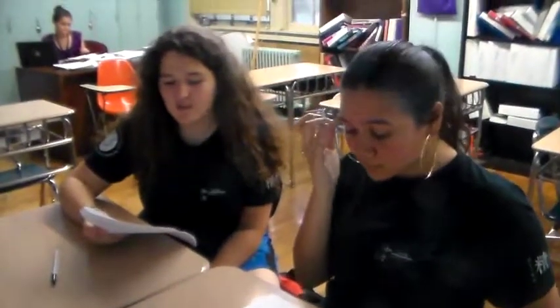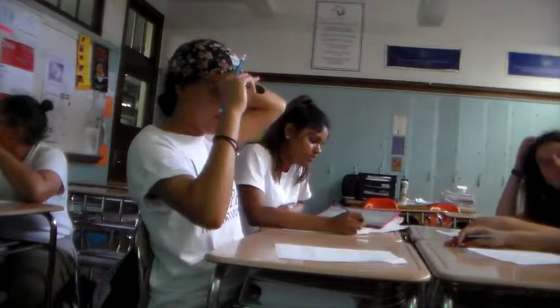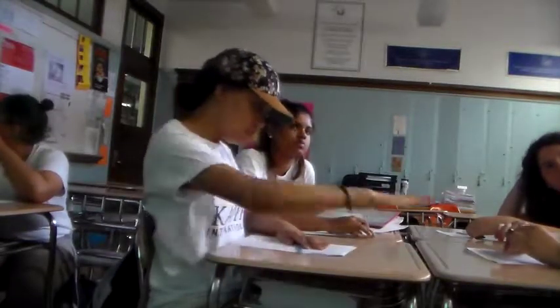If we have equal amounts of acid and base, then the solution will be neutralized because the base and acid H ions cancel out. We say that if acids and bases have the same concentration, then they will neutralize each other because of their opposite charges. You have your testable question, you have your hypothesis, and they're both good. Now I'm going to tell you what materials you're going to be using today, and then after knowing that, you're going to refine your hypothesis based on what you know you're allowed to use.